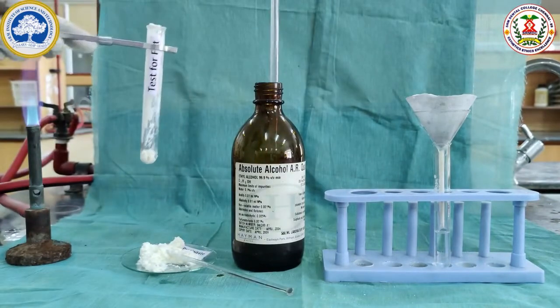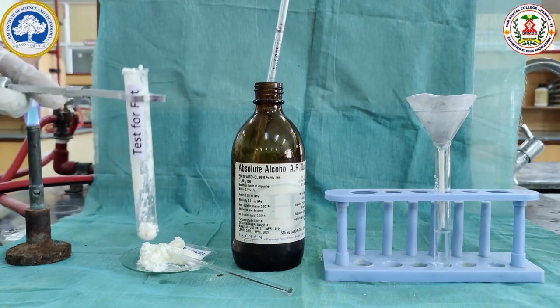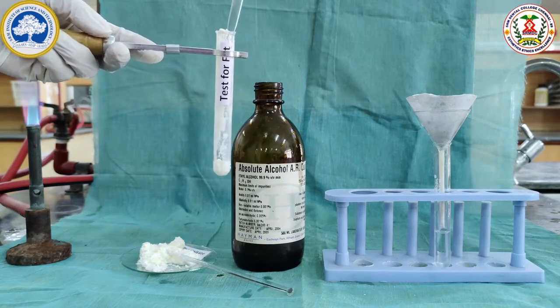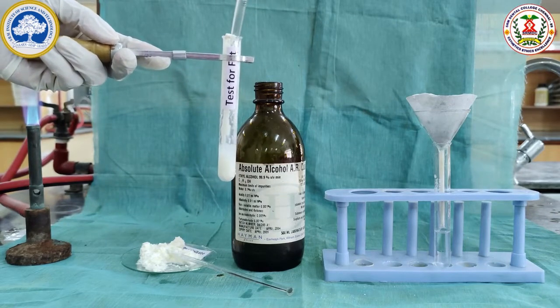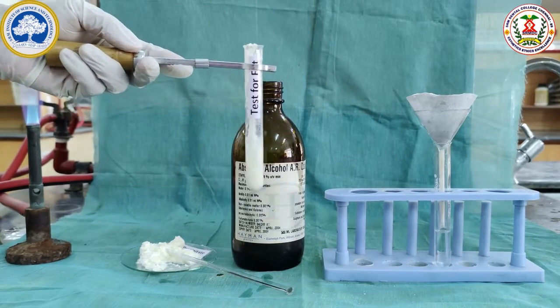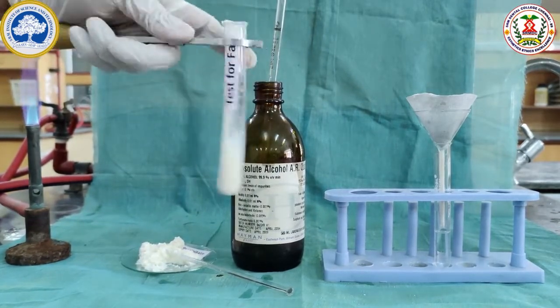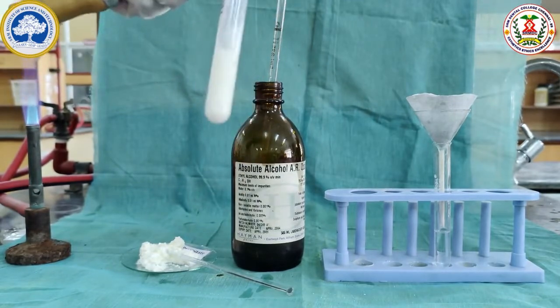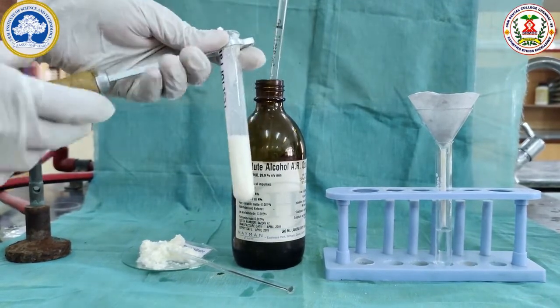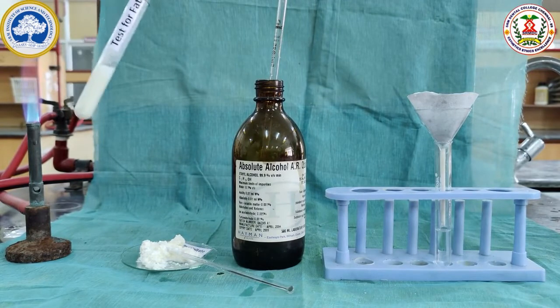This is dissolved by adding 5 ml of alcohol to dissolve the fat from the precipitate. Slightly it is warmed to release the fat from the precipitate.